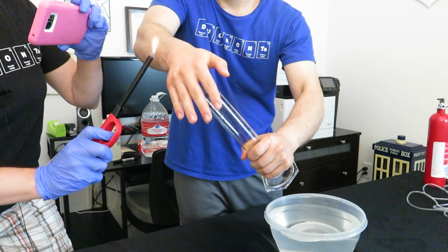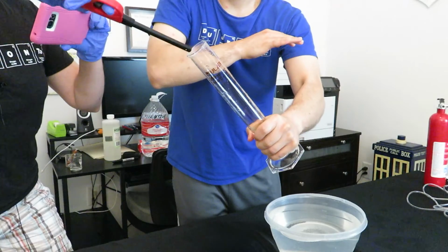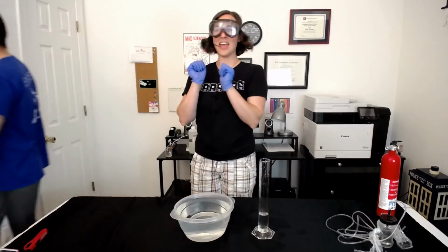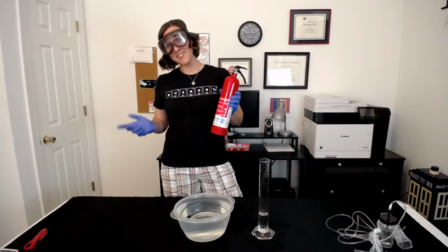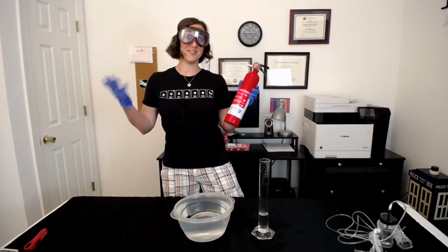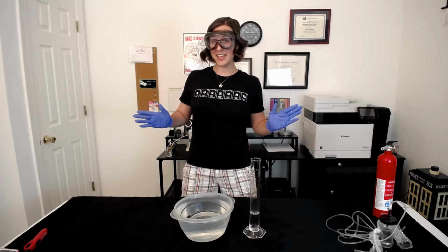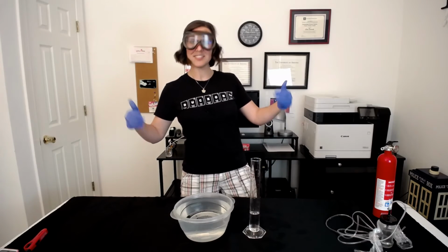1, 2, 3. Ta-da! Thank you, lovely assistant. Luckily, we didn't have to use our fire extinguisher for this lab. Now let's head back into the classroom and do the calculations for all of the experimental values that we collected.